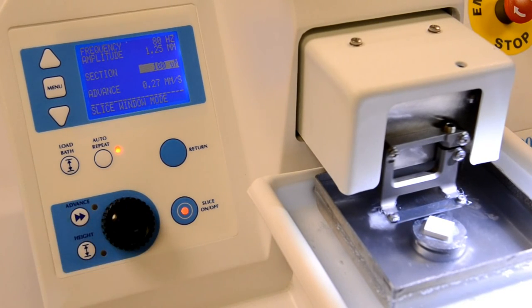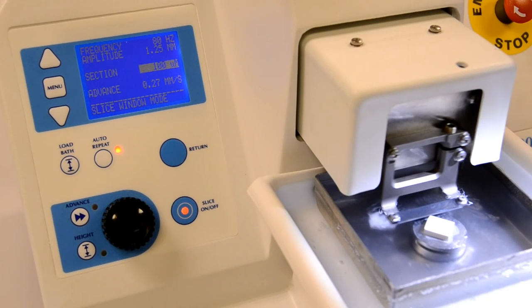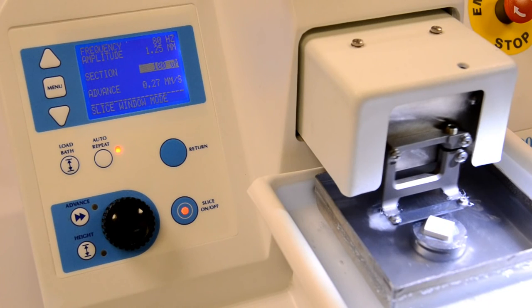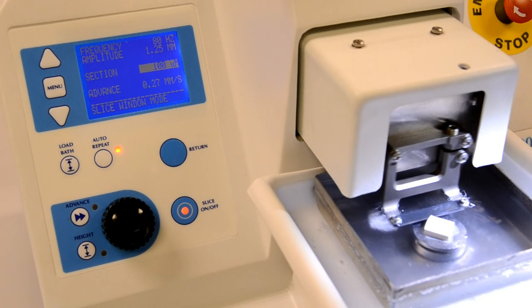You will have to use the rotary knob to set an advance speed for the first cut. You can then repeat the cut as often as you wish. All you have to do is press the return key to bring the head back to the start and then the slice on-off key each time.